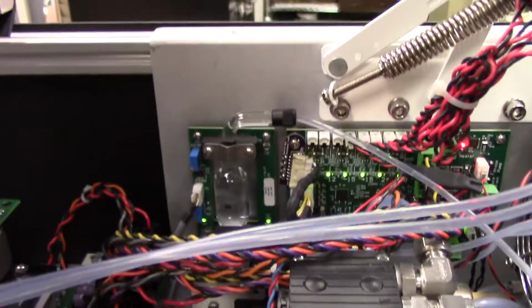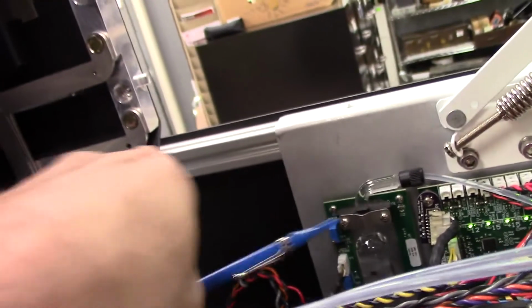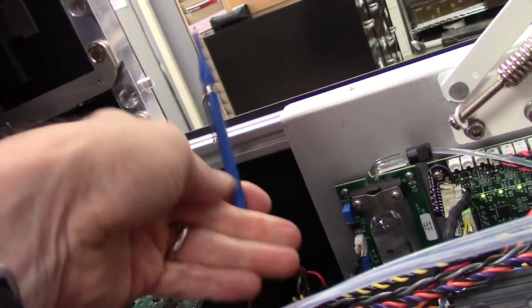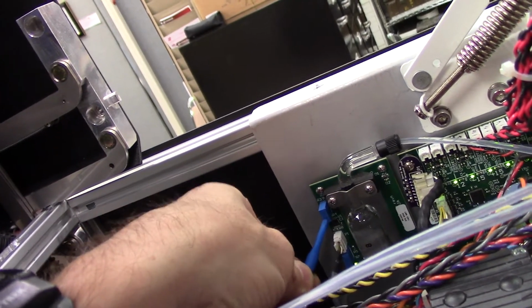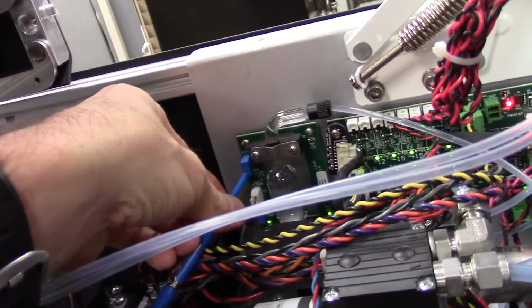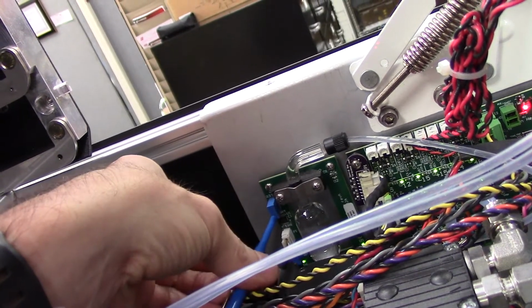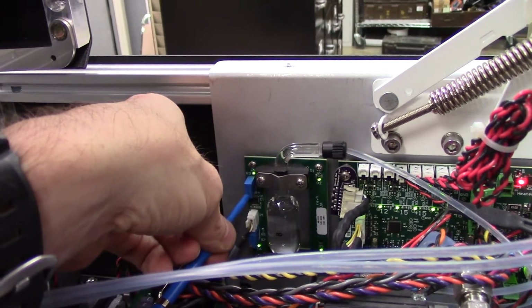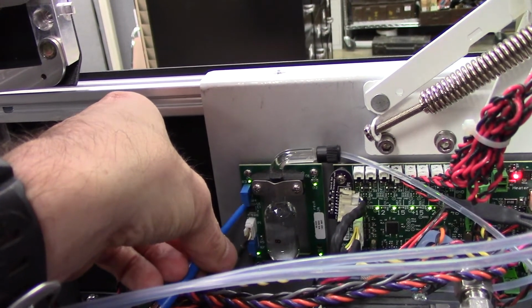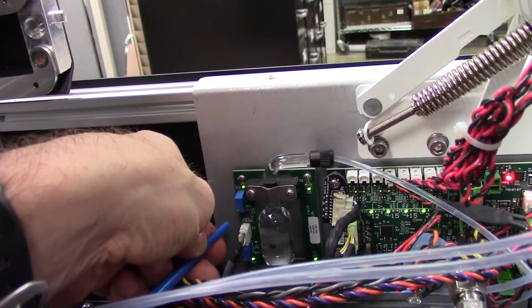Now, here's the critical adjustment. The top sensor, the top LED is not lit right now. Using an adjustment stick, the sensor just came on. Now I turn that one additional half turn to make certain that it's good.